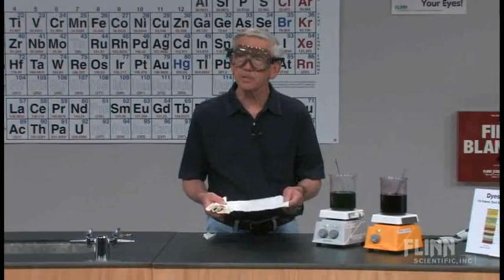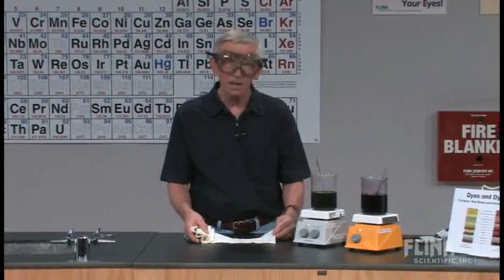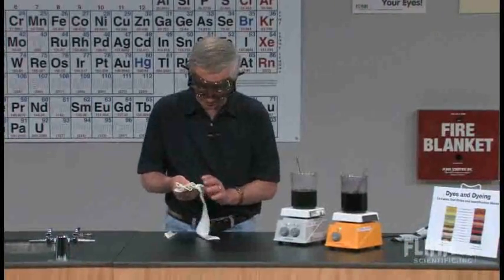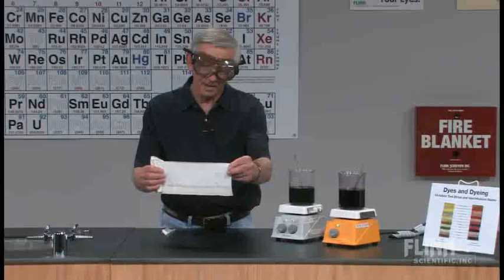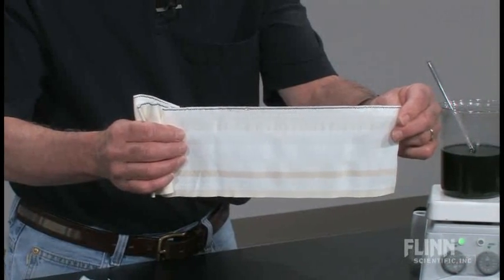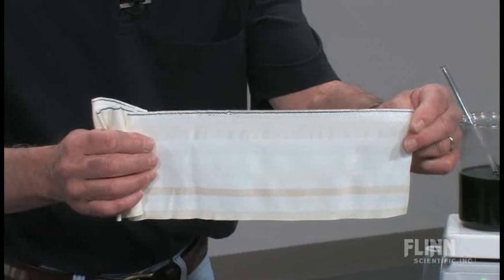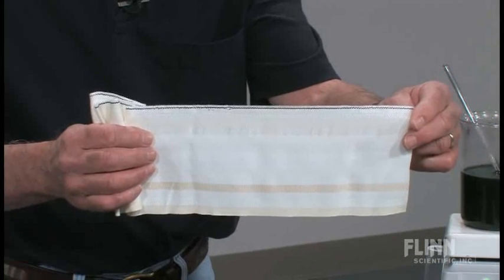When I was developing this, I was in contact with a company called Test Fabrics, and they make a number of fabric samples, of which this is one. You see the black line at the top — starting from there and going down, there are 13 different fabrics.